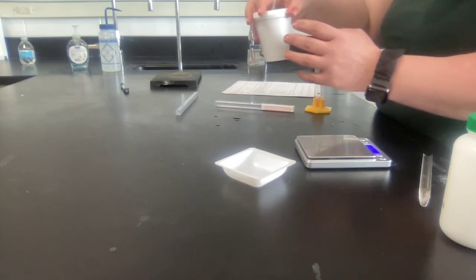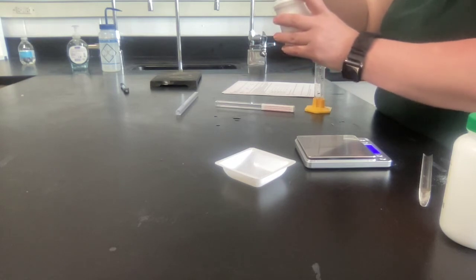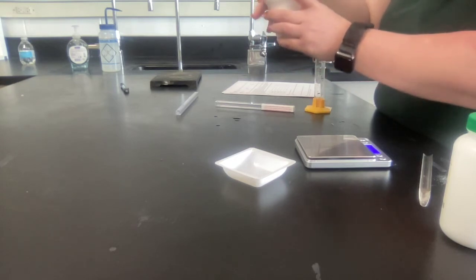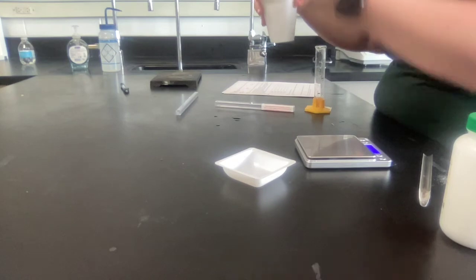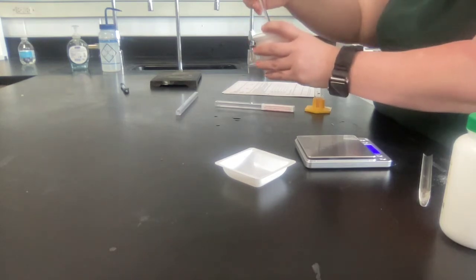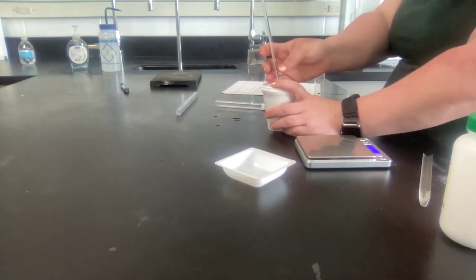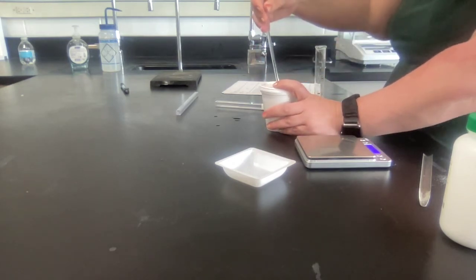You're going to watch the thermometer throughout the entire thing. When it stabilizes in temperature, it's either going to go up or go down. When it stabilizes in temperature, write down the new temperature. That's going to be your final temperature in degrees Celsius.